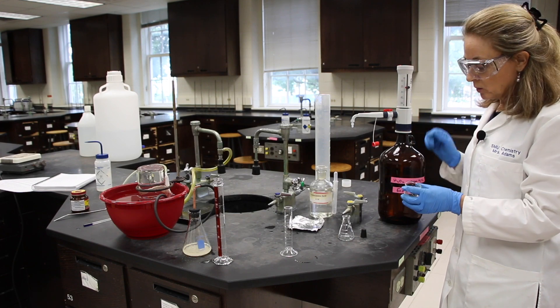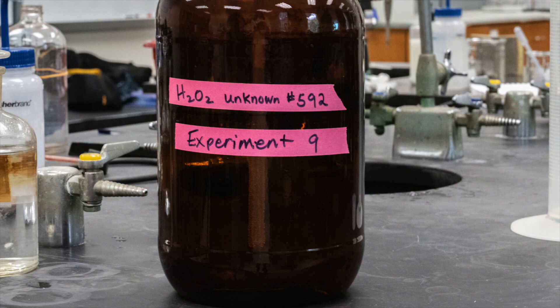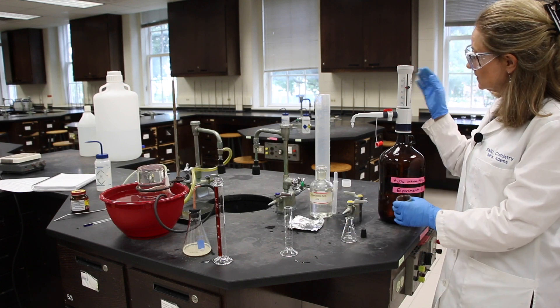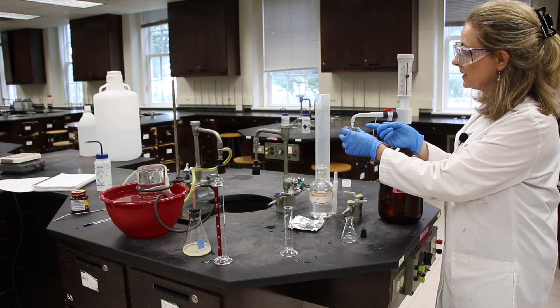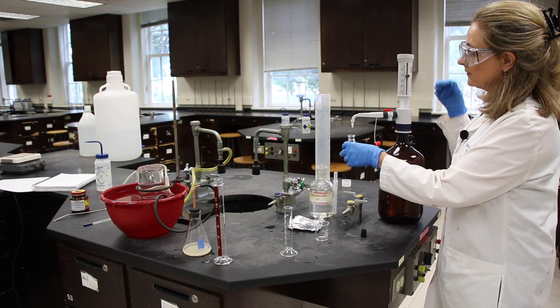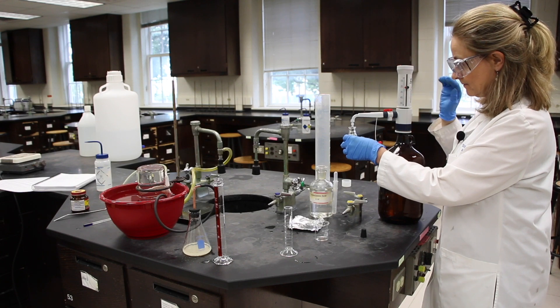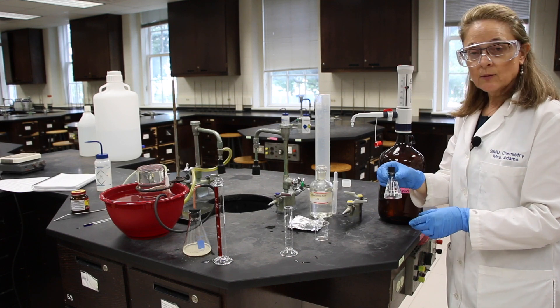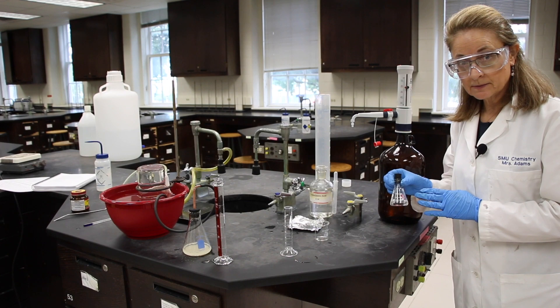In the next step, we'll dispense 20.0 mL of this hydrogen peroxide unknown to an Erlenmeyer flask. First, we lift up gently on the barrel. If there's a waste drop that comes off, we'll get it in our waste beaker. We'll put our Erlenmeyer flask underneath and press down gently. We'll stopper this immediately, and we'll proceed to the next step quickly, because hydrogen peroxide does decompose quickly.